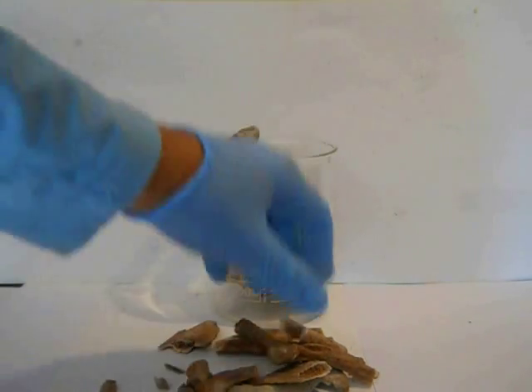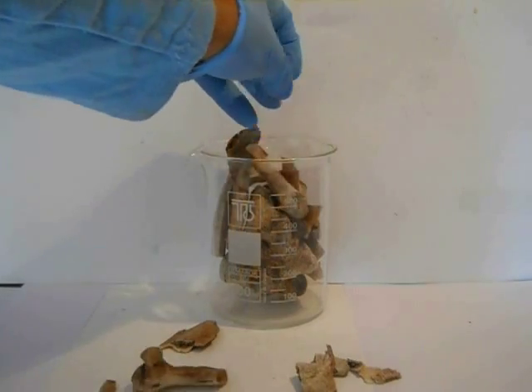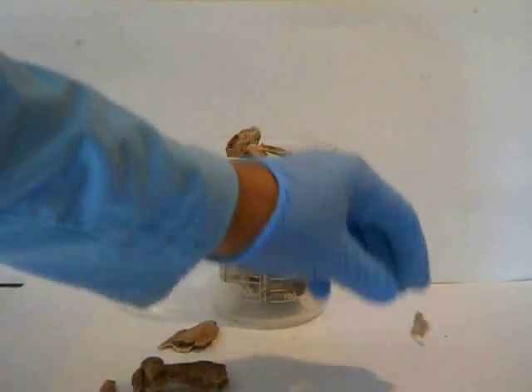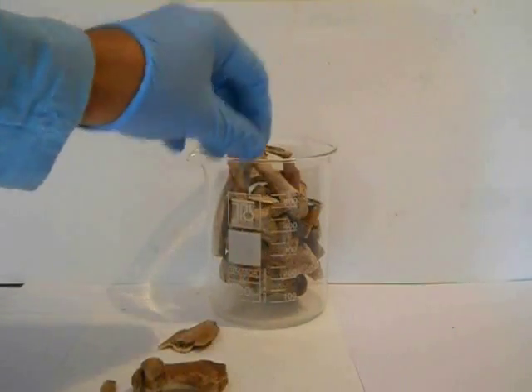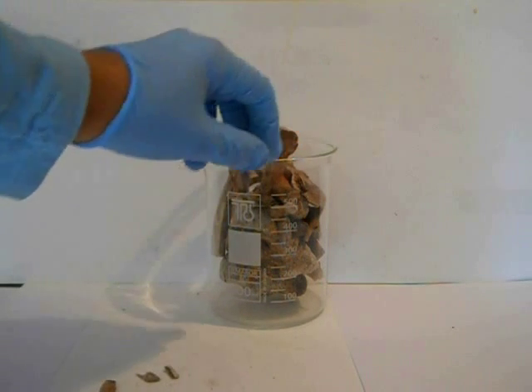Now, crush the bones containing calcium phosphate with a mortar into very small pieces. If the neighbors complain because of the noise, tell them it's my fault.